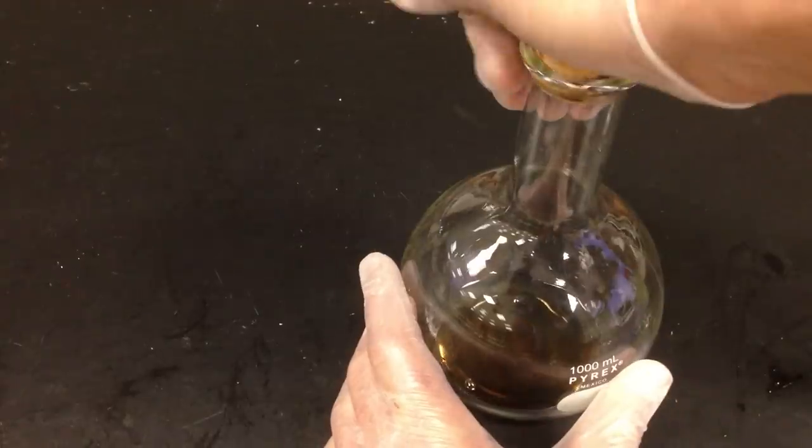And now what I'm going to do is shake, shake, shake. And I'm going to shake this glassware. And hopefully, if I made this reaction carefully, we should see some plating occurring. It takes a few minutes. So I'm going to shake. And hopefully, you can see a chemical reaction taking place and that solid silver up here. You see there's a reflection on my glassware already. So you can see that we're probably making a solid already.